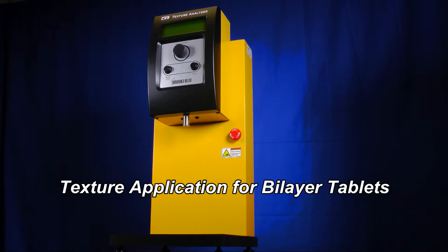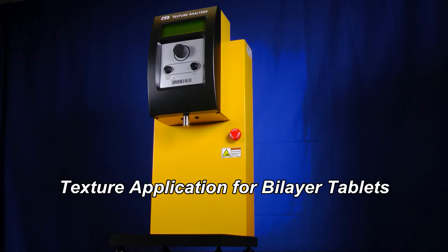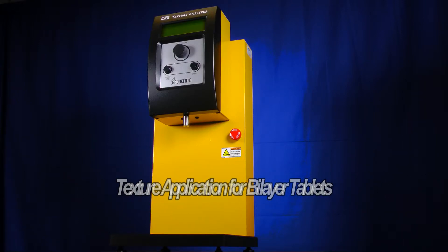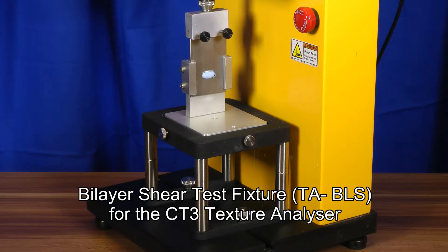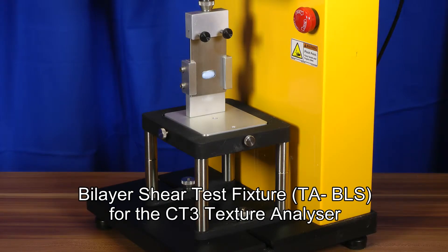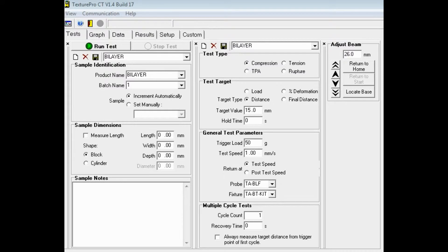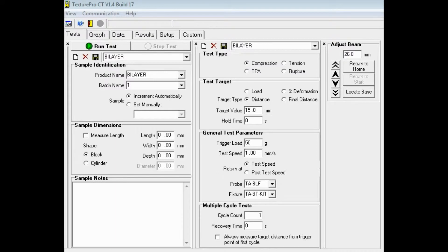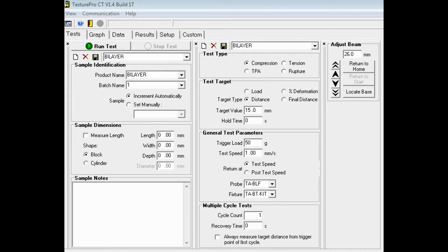This is a shear test for bilayer tablets using the CT3 Texture Analyzer. Here you see the bilayer shear test fixture assembled for the test. This test shall be performed using the Texture Pro CT software.